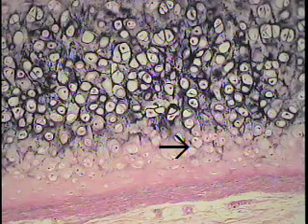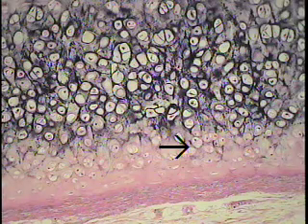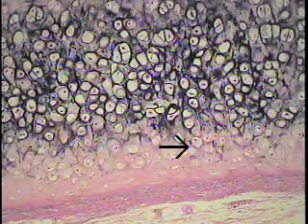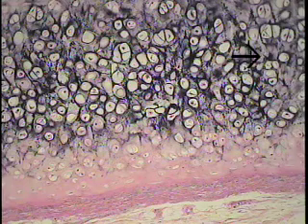This is slide number 20, human epiglottis, stained specifically to demonstrate elastic cartilage. This preparation has been stained to demonstrate elastin. Elastic cartilage is identical to hyaline cartilage in many respects but in addition has an abundance of elastic fibers within it. The same features are present: a surrounding perichondrium, chondrocytes within lacunae, and between the lacunae coursing throughout the matrix these dark black fibers — elastic fibers — in addition to collagen and ground substance as is true of hyaline cartilage.